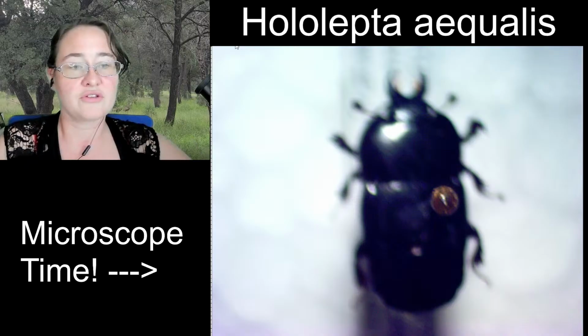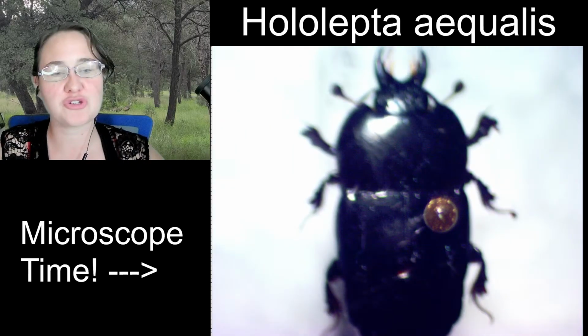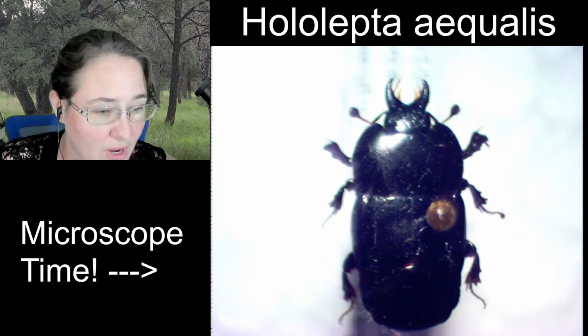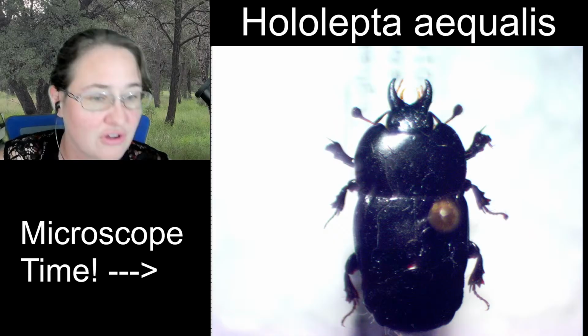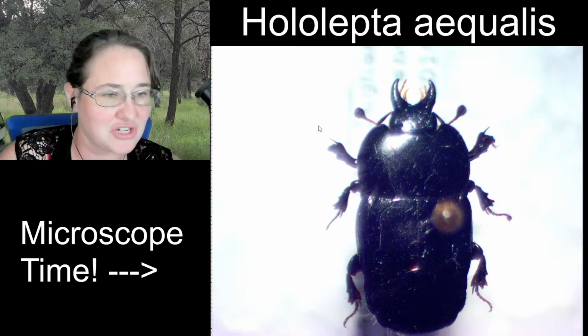At this point, I do believe that we have gotten all of the measurements that we need. We've talked about where it was collected, when it was collected, a little bit about its behavior. So I think that it is about time to get this beetle sketched.